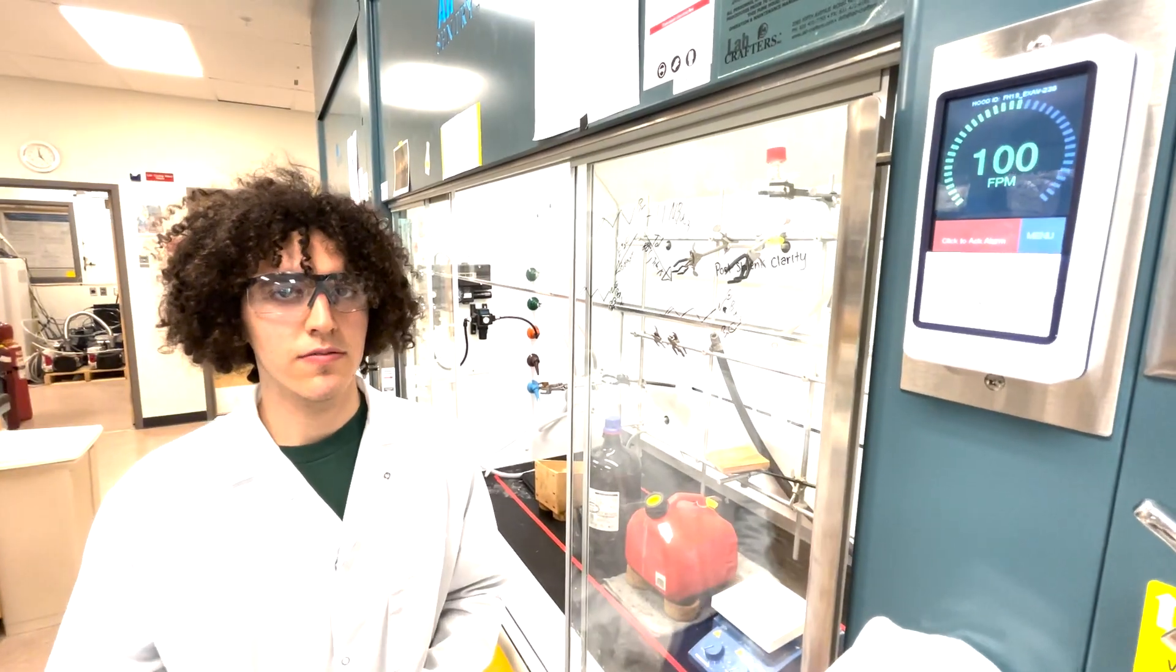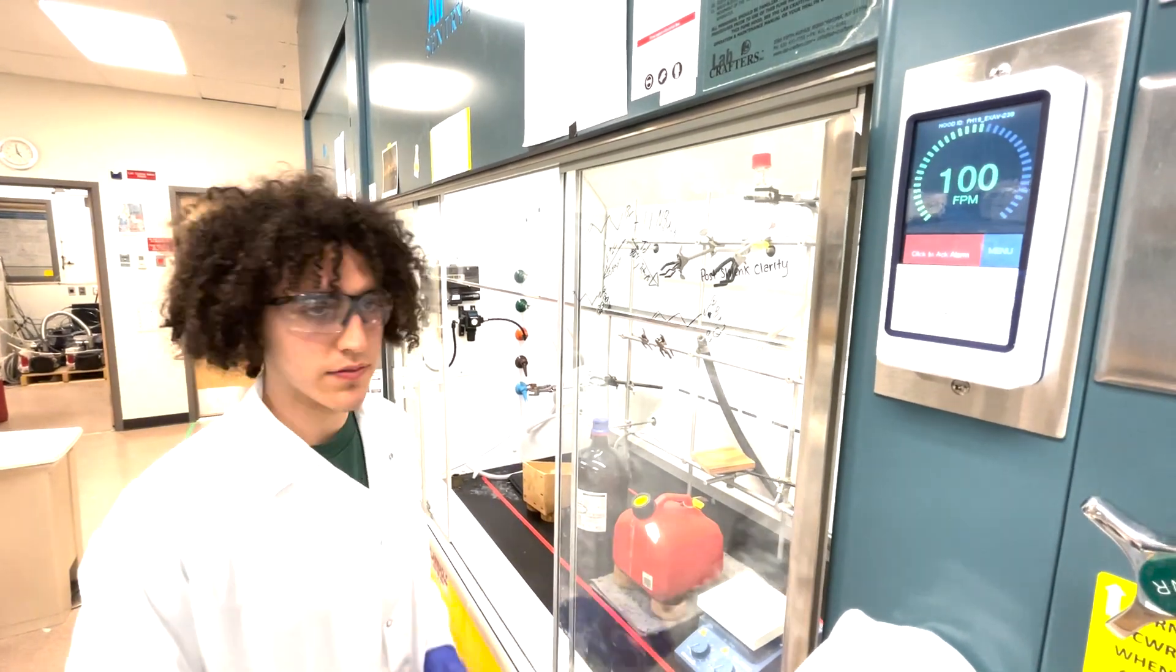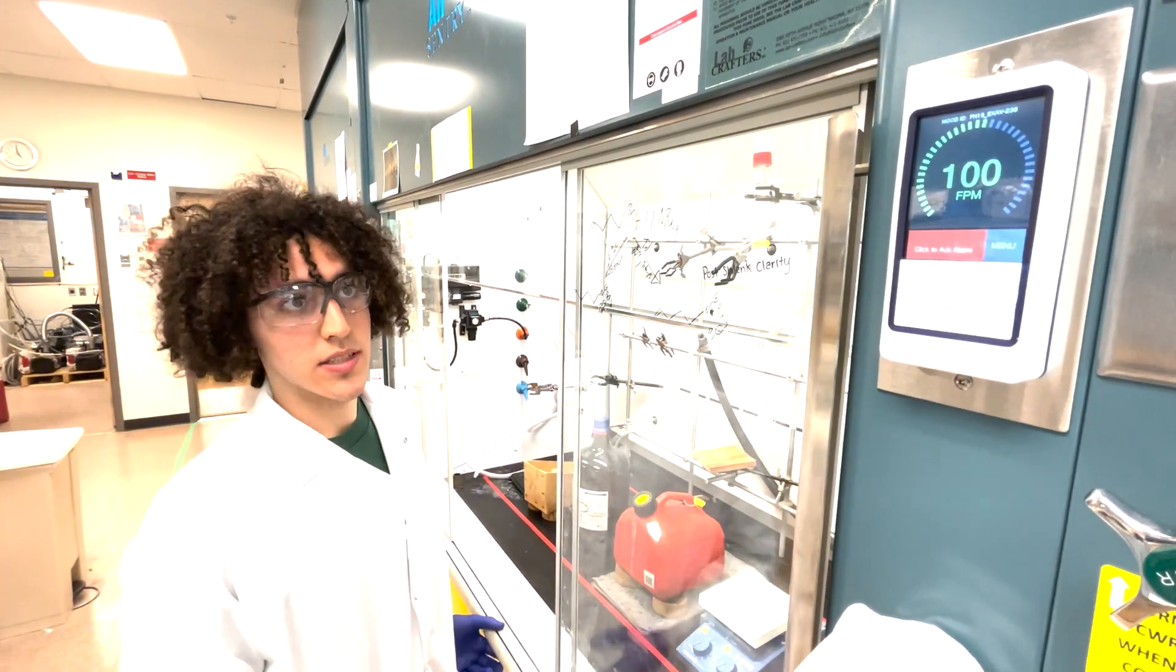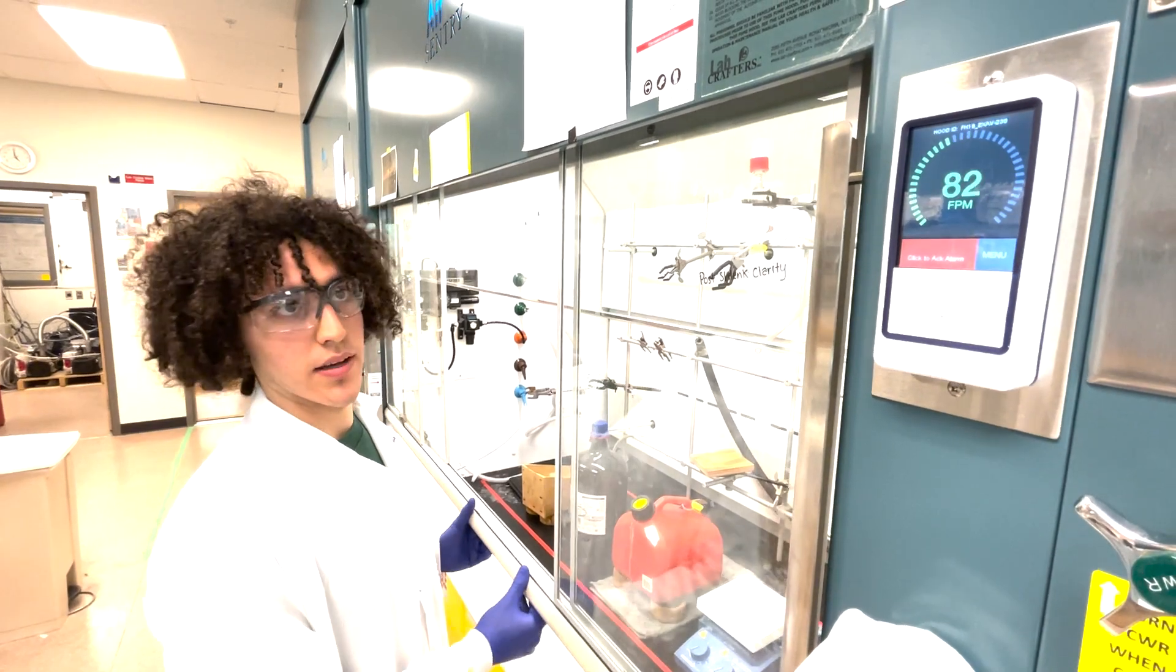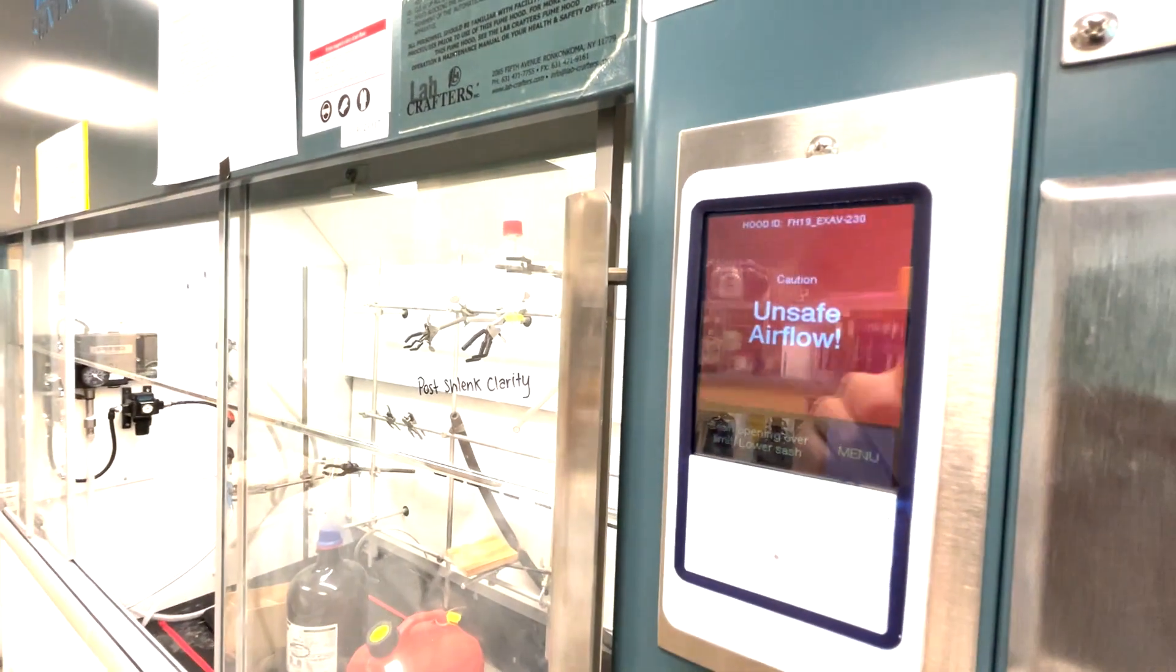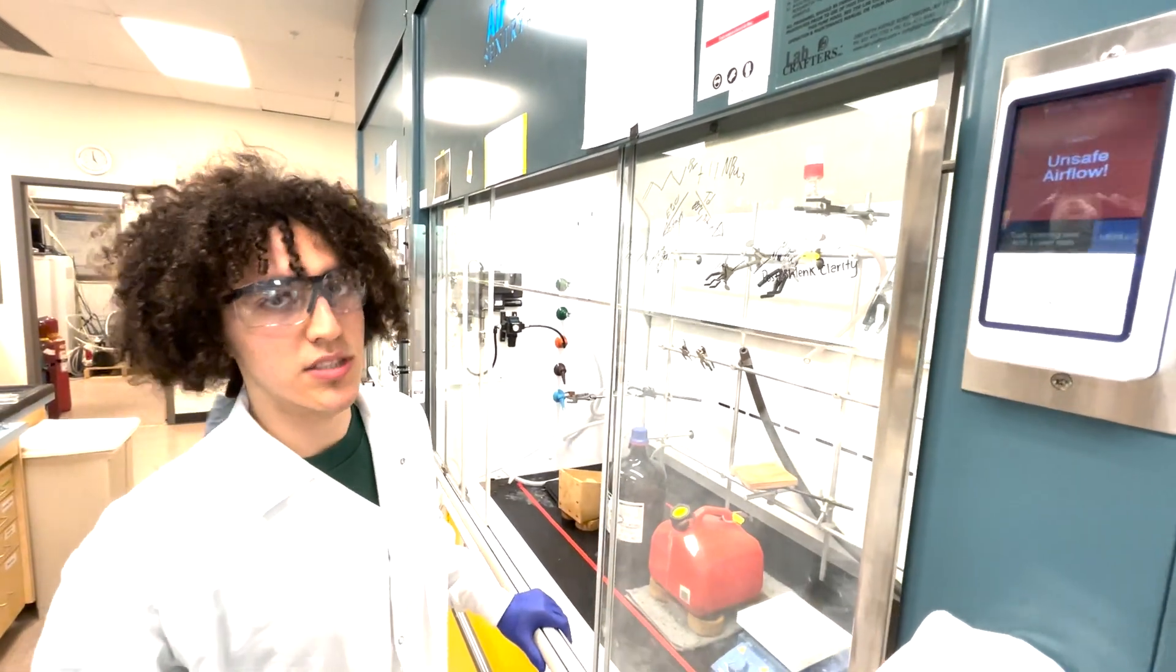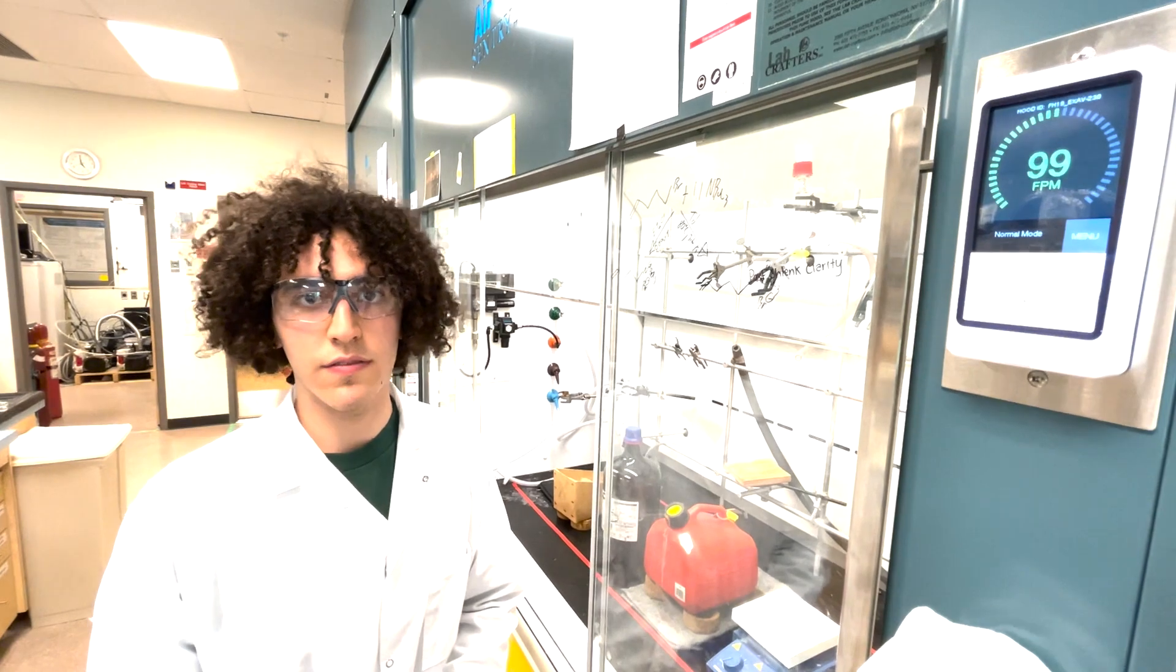As you may have heard in the last shot, when I was discussing the impact of researchers on the airflow, there was beeping present when I raised the sash height too high. This beeping occurs when the airflow drops significantly. Here we have a face velocity of the fume hood that is too low for proper containment of fumes within the hood.